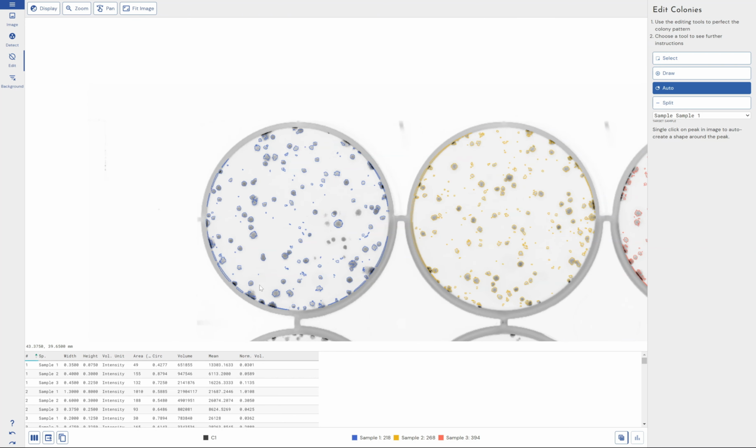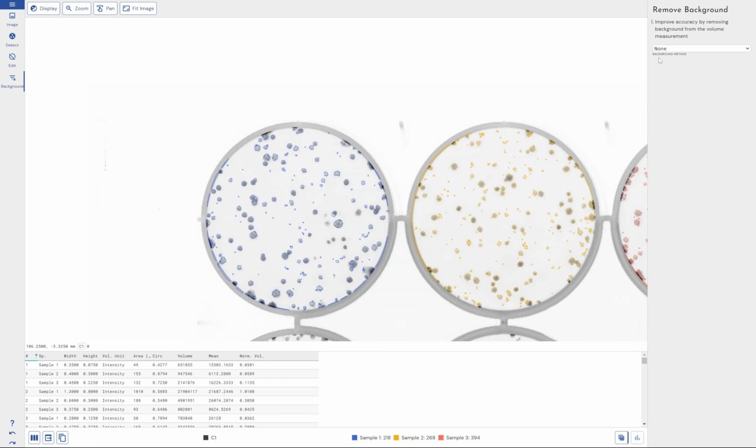And that's basically it. So for these measurements, if you're particularly interested in spot measurements, we can also perform a background correction. So we have image rectangle mode non-spot, which means the mathematical mode of the non-spot area within your area of interest. So everything that is not a spot, we take the mode pixel value of that and set it as the background. Surface minimum takes 1 pixel outside of the radius of the spot and analyzes all of those and selects the lowest value outside your spot to set as the background.